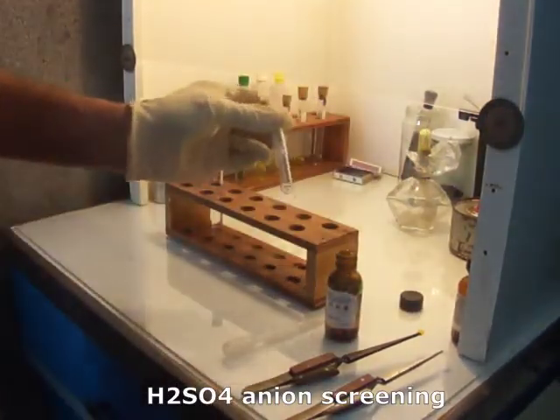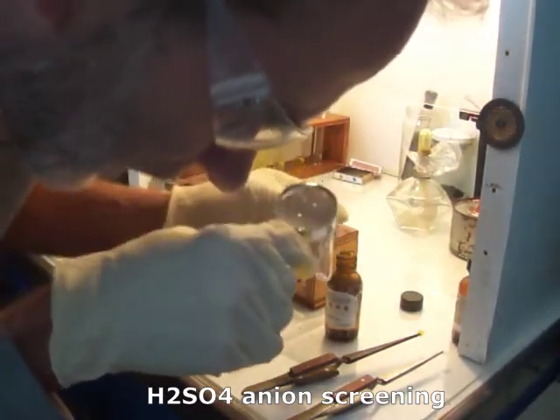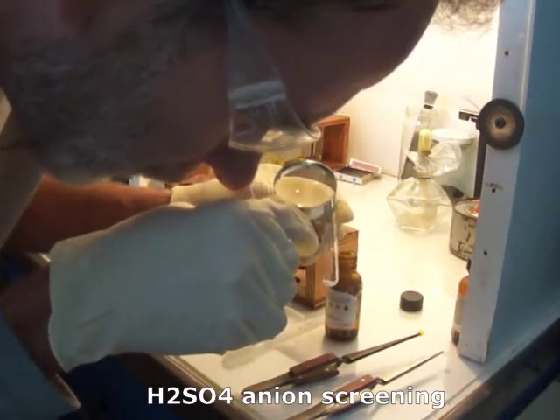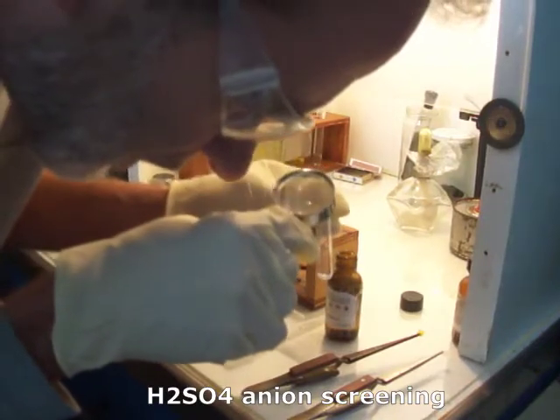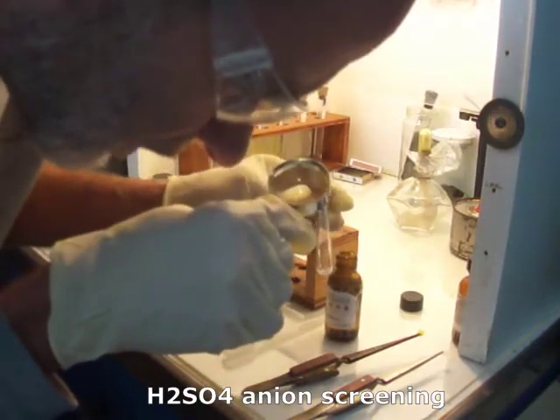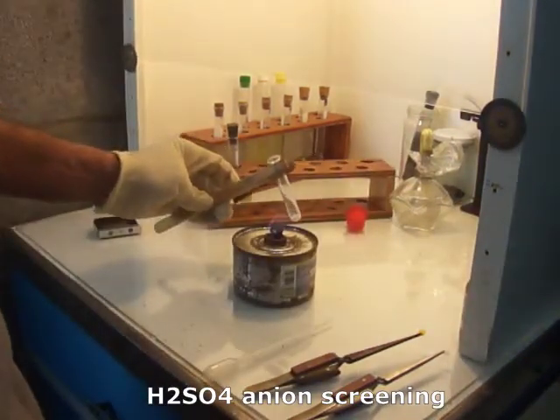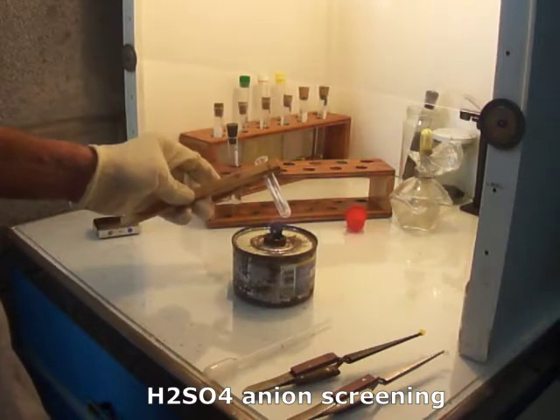Boy, I can't even see it. I guess when they say semi-micro analysis, they're not kidding, because it's hard to see. But I don't see any effervescing or anything going on there. So I'm going to heat it just to see if there's any. I think it says look for brown gas, so let's try that. It says heat it, but not to boil the sulfuric acid, and I don't see any fumes.